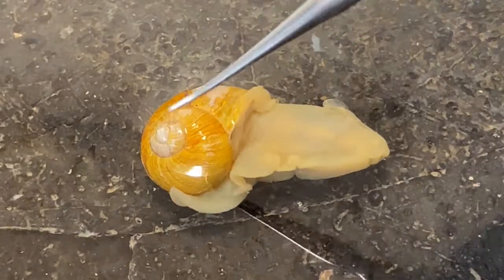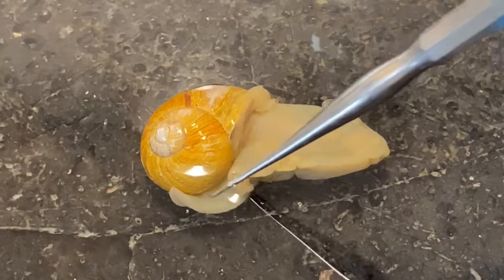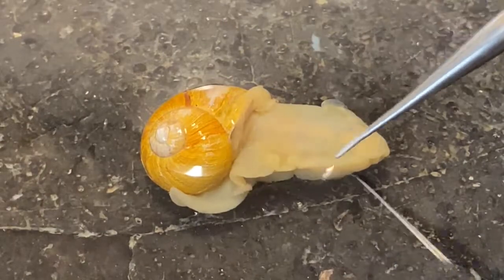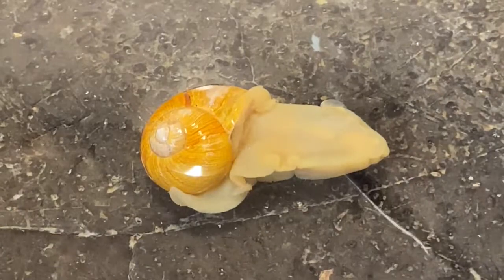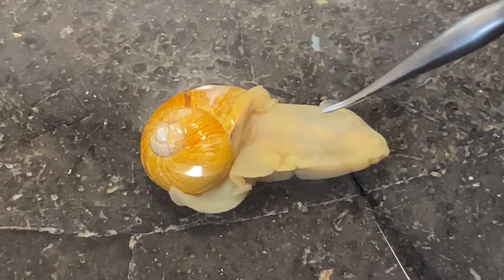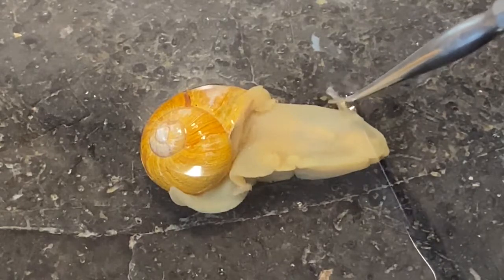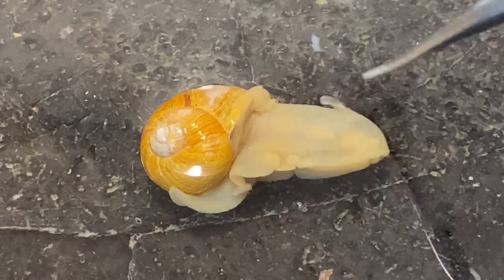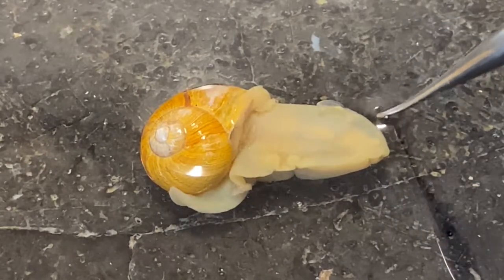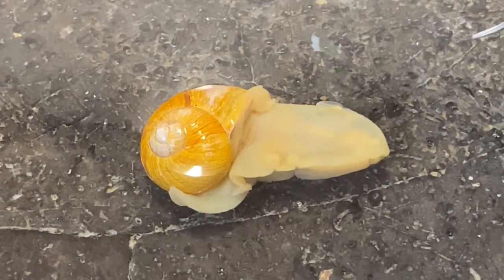So of course we have the coiled shell, then we have the muscular foot that runs the length of the body, then there are two pairs of tentacles. They're a little bit tough to see on this specimen, but there is a posterior set of tentacles here, and an anterior set located up here that in this specimen have been retracted.